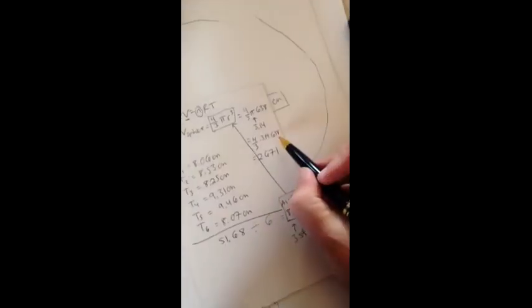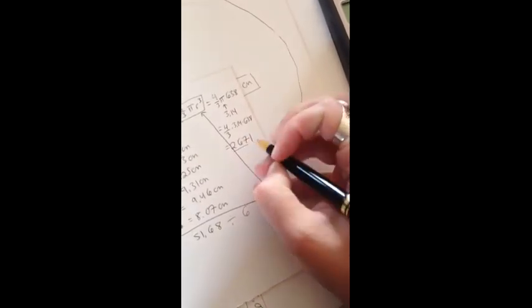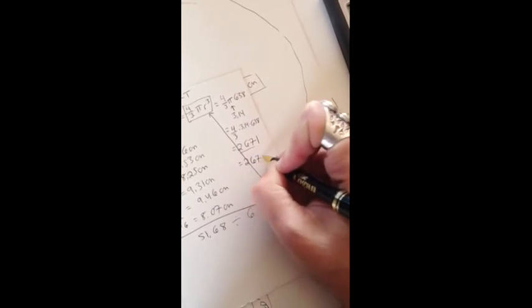And there's some decimal place measurements as well. But we want to keep 3 significant figures. That's these 3. The 1 is less than 5, so we're going to keep it at 7. 2670 with no decimal after it. And that is cubic centimeters.